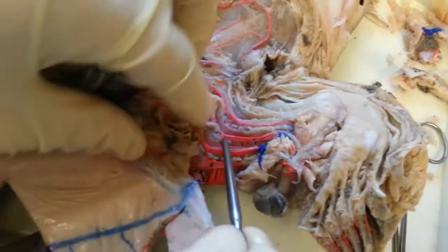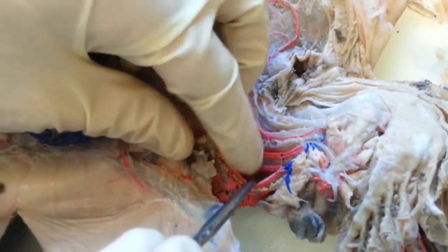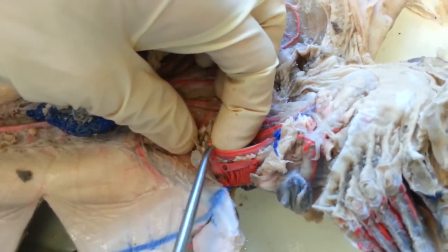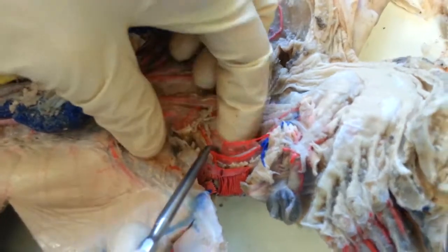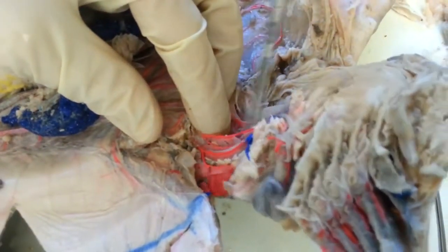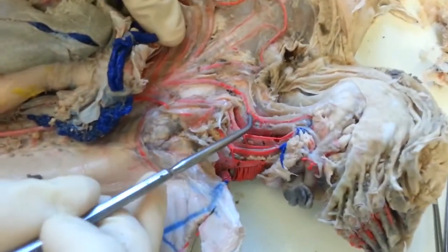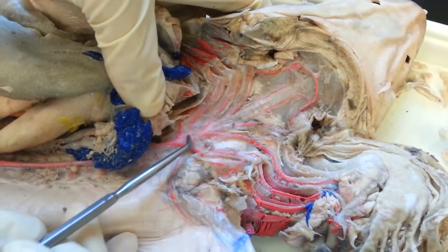The afferent branchial arteries do a loop within the gills where they're picking up oxygen. For reference, use the gill arch or the gill slits. The collector loop is made of post-trematic arteries, which are below the gill arch, and the pre-trematic arteries are above the gill arch. They're connected, so use the gill arch as your reference. Coming out of the collector loop, you have the efferent branchial arteries, which then lead into the dorsal aorta.